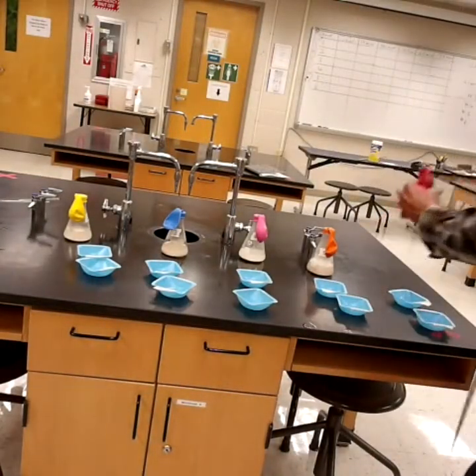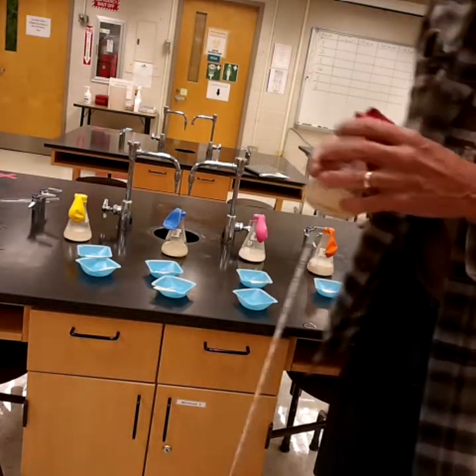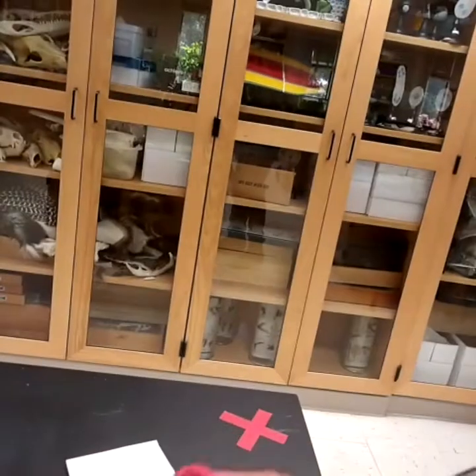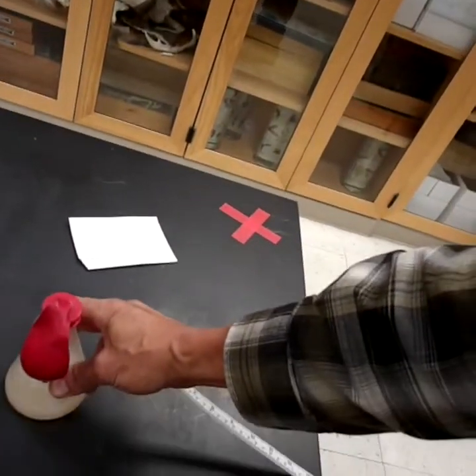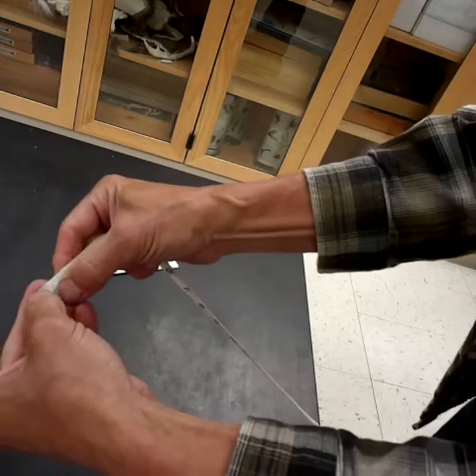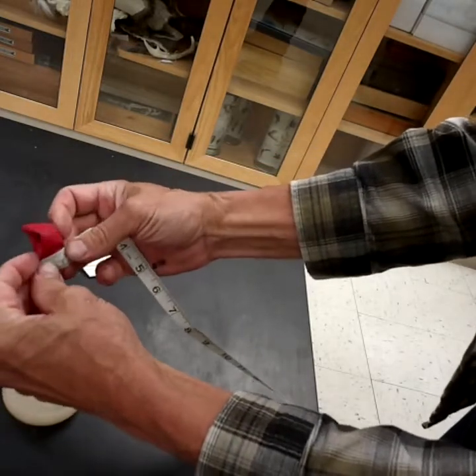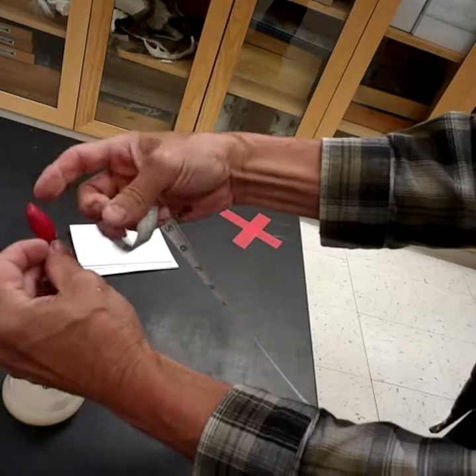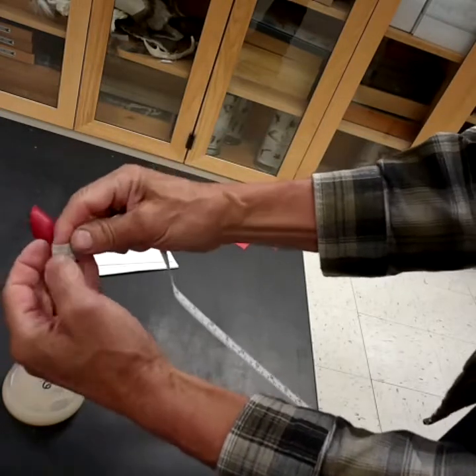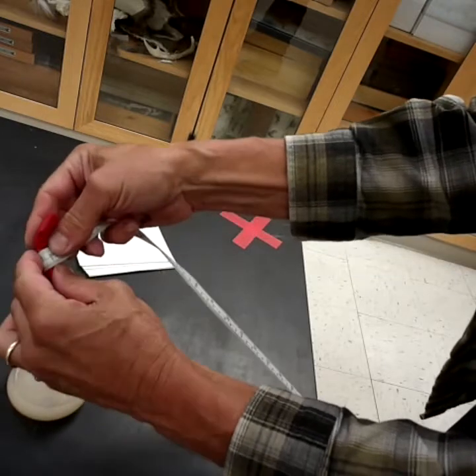So I'm going to take this tape, and for the initial measurement, all I'm going to do is, so a better view here, I'll use centimeters here, the millimeter or metric side of this thing. And I'm going to just go around the fat part of the balloon. Of course, it's empty right now, so the circumference is going to be tiny because there's nothing in it.